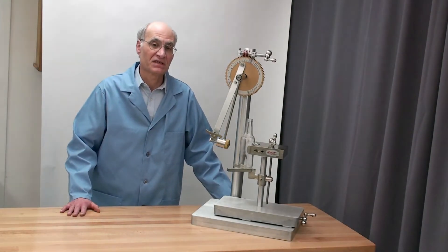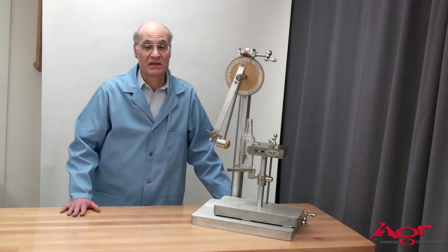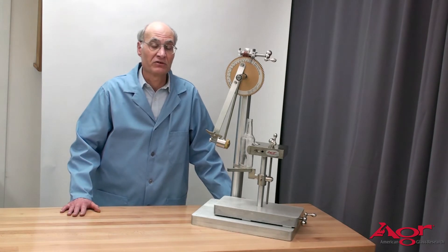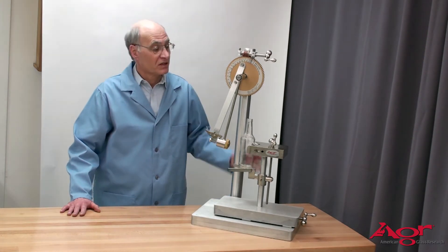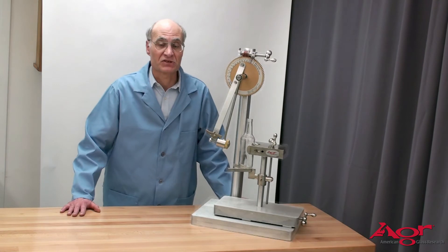We're here to discuss impact breakage of bottles — impact testing in bottles. What we'd like to do is look at various types of impact demonstrated on our impact tester.